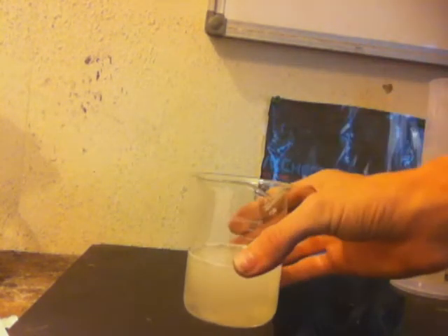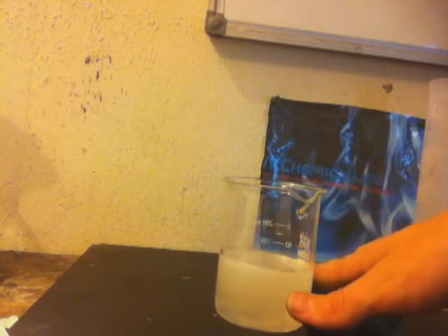I know I need a bigger beaker than my 150 ml beaker. Now that you've got this solution, just let it sit for a little, and then filter this. You're gonna have to filter this twice. Make sure you get all the products out of the solution — this should just be binders, that white stuff floating at the top. After it's filtered, add hydrochloric acid — I'll show that in the upcoming clip.